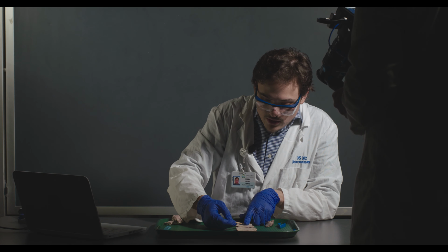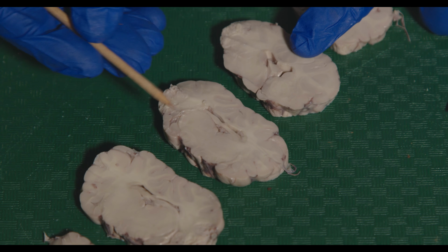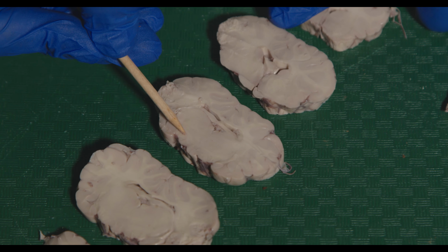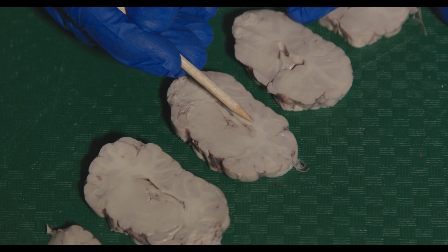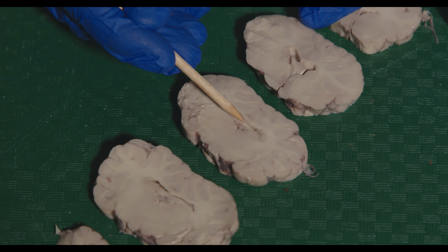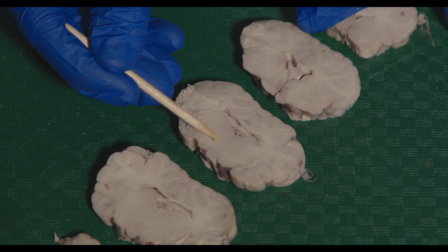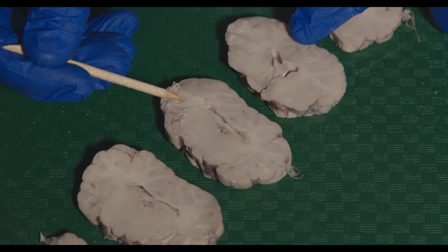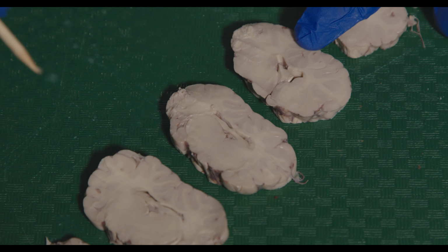All right, so now if we go even further back, the basal ganglia structures really get pushed to the edges, and it's really hard to see. This giant structure here, this is the thalamus. And you can still see the corpus callosum connecting the two hemispheres over here. But you can also see the fornix, which we haven't really talked about yet, which is essentially the major output of the hippocampus. But we can see essentially the thalamus readily apparent. And then, of course, you can see some of the corona radiata that we can see coming out from where the internal capsule was.